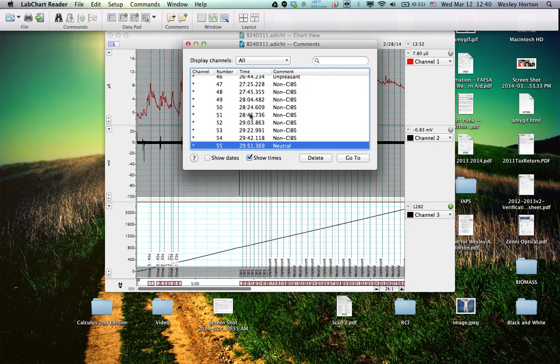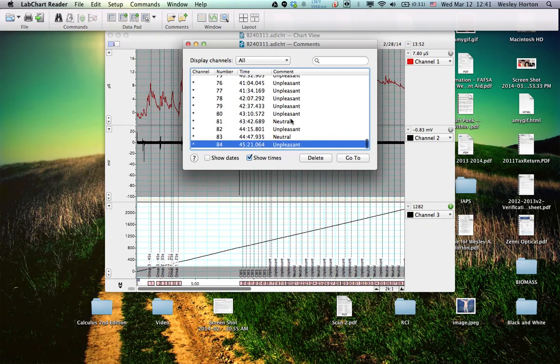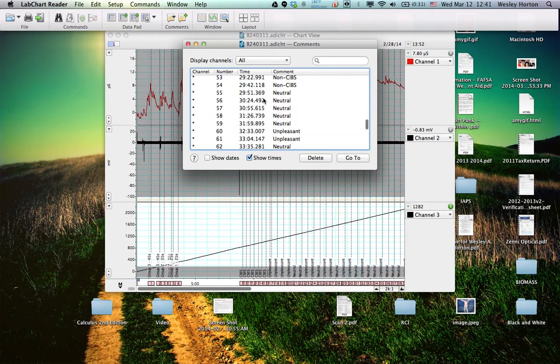And so we're going to have 30 of these. 1, 2, 3, up to 30. So there are 30 of those, and that's correct as well. Alright, so that's cleaned up, and we deleted the ones that we don't need.